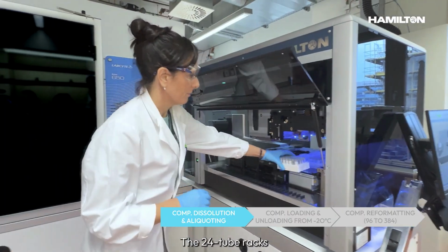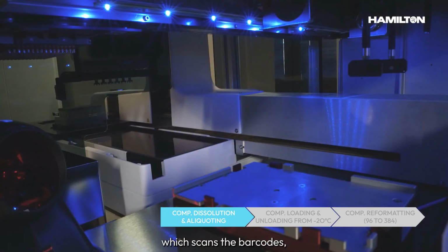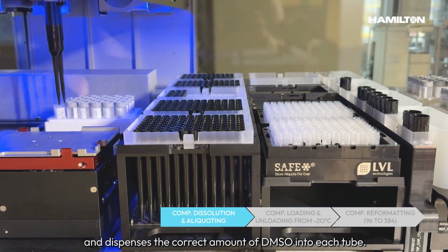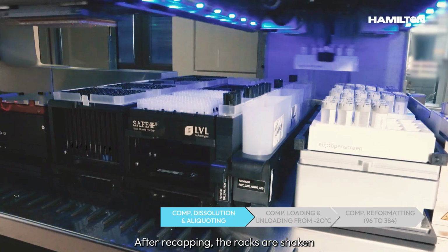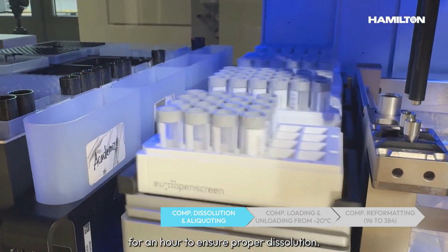The 24 tube racks are then manually loaded into the Starlet and Lab Elite system, which scans barcodes, removes tube caps, and dispenses the correct amount of DMSO into each tube. After recapping, the racks are shaken and incubated on the Hamilton heater shakers for an hour to ensure proper dissolution.